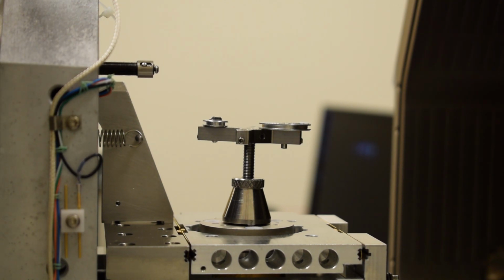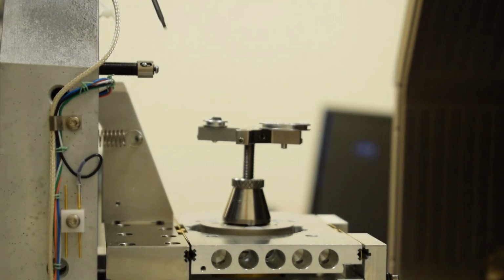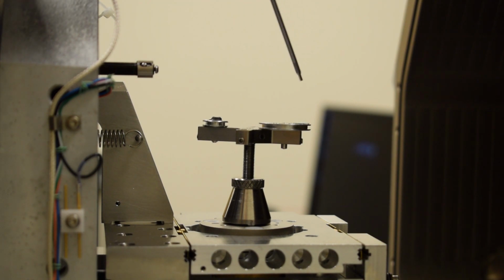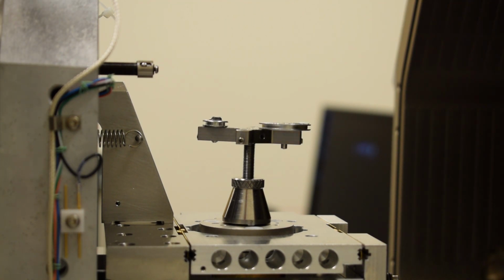Right. Now, these two samples have different heights. The sample on the left, I should point with this wrench here, the sample on the left is approximately 1 millimeter taller than the sample on the right. Now, in order for us to load these samples safely, we need to get them at the same height. Now, I cannot shorten the sample on the left, but I can raise the sample on the right up before I tighten the set screw.